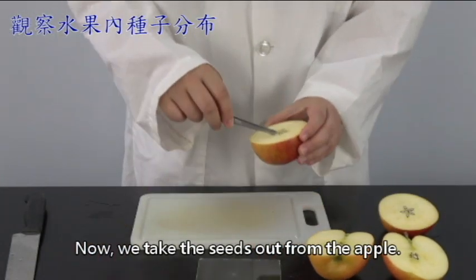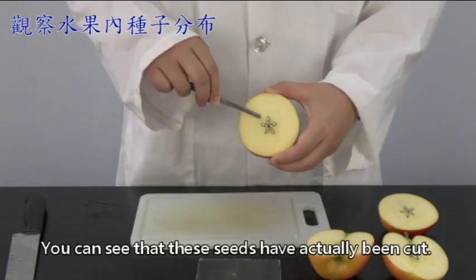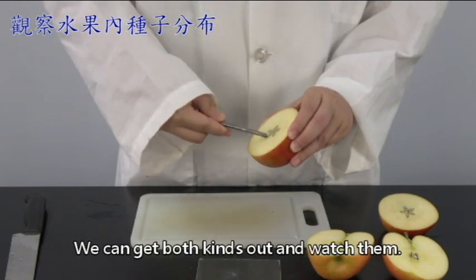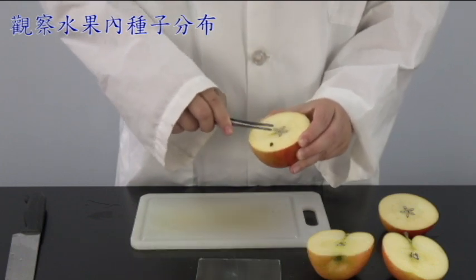Now, we take the seeds out from the apple. When we're getting the seeds, we can get the ones that have been cut and those that have not been cut. We can get both kinds out and watch them.